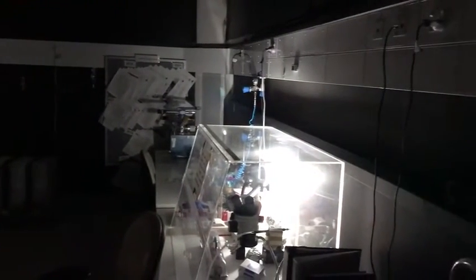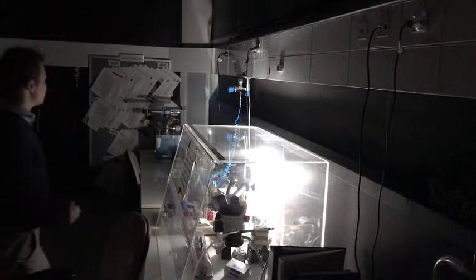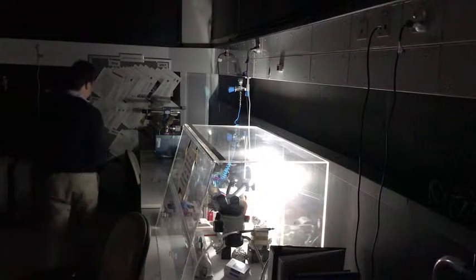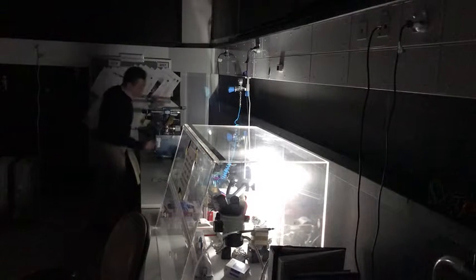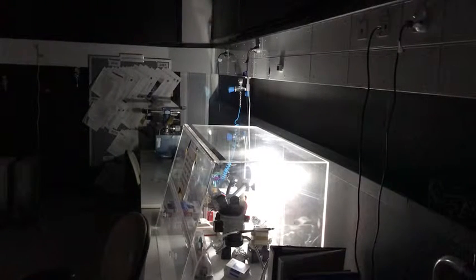The first thing we have to do is turn the pumping station off because it takes a while to vent. So I'm going to just change the angle to look over there. That's the pumping station in the distance. The reason why I've still got the lights off is because I still need to do things with the beam and it's harder to see when the room lights are on. So close the valves, turn off the pumping station, wait for that to vent by itself, go back to the microscope.